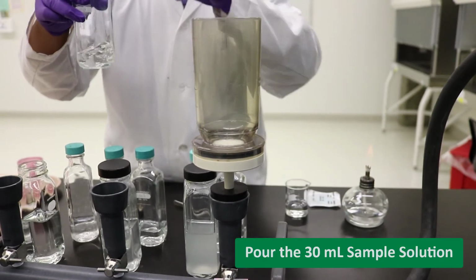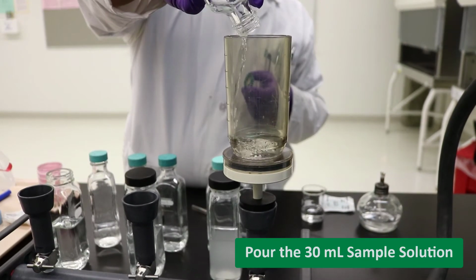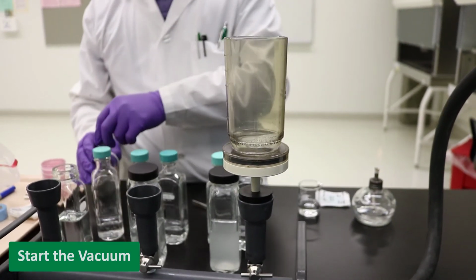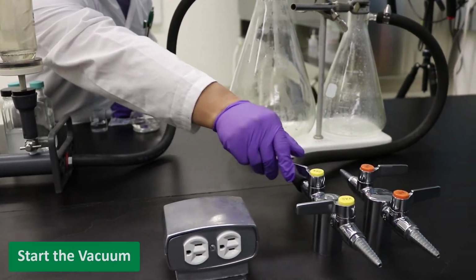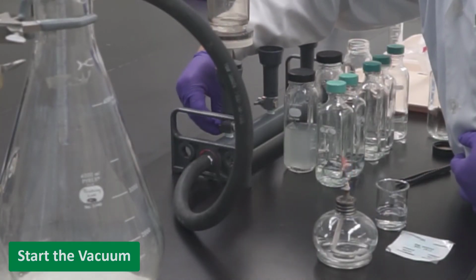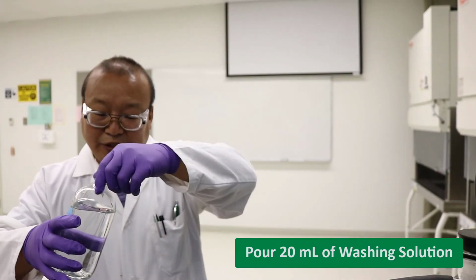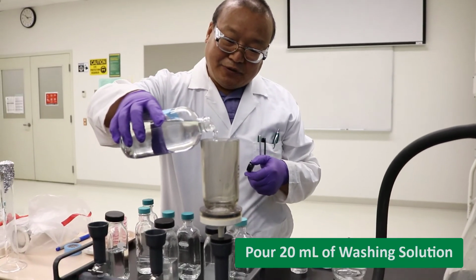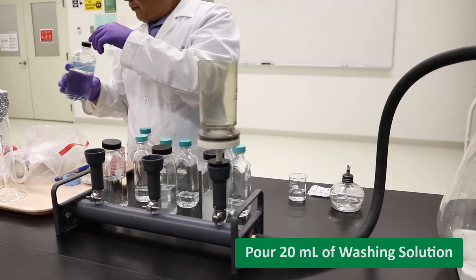Pour the 30 ml sample solution from earlier into the filter cup and start the vacuum to begin filtering. Pour in about 20 ml of washing solution to wash the wall and make sure all cells are on the membrane.